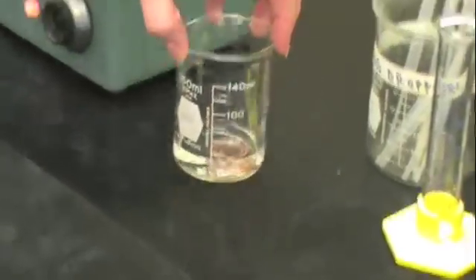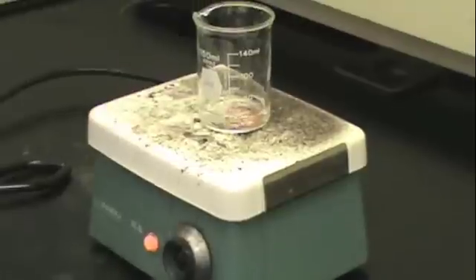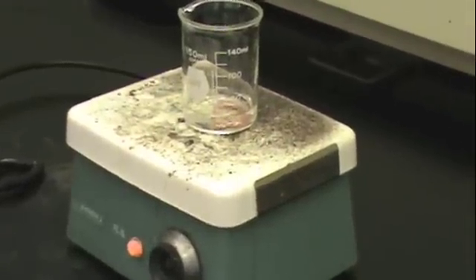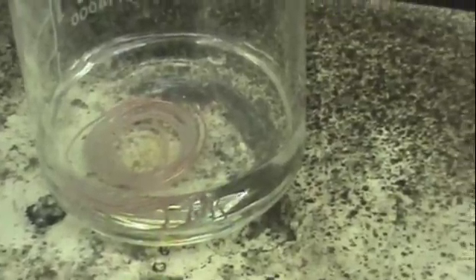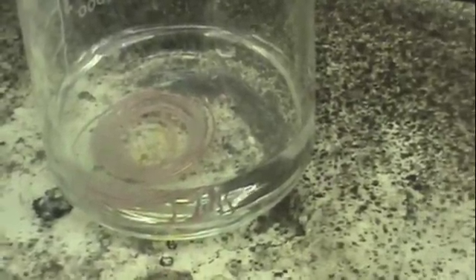Then drop your coil into the nitric acid solution and put the whole setup on a hot plate set at about 4 or 5. You will notice that the reaction starts to bubble immediately as bubbles form on the copper wire.